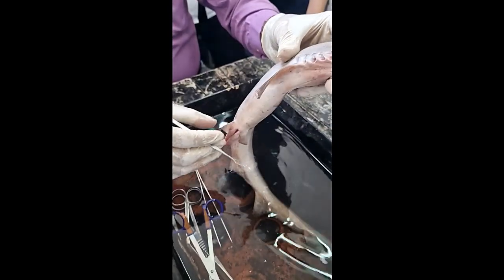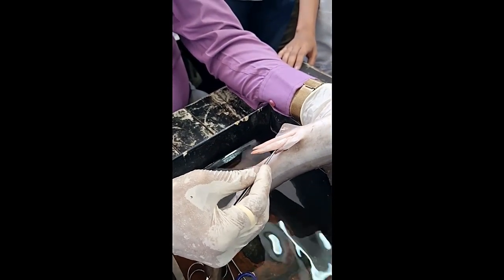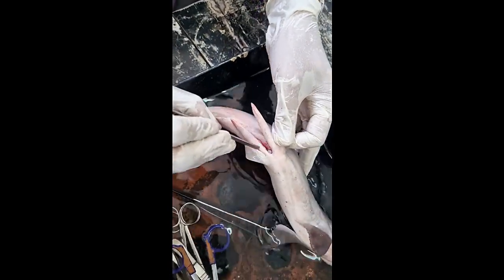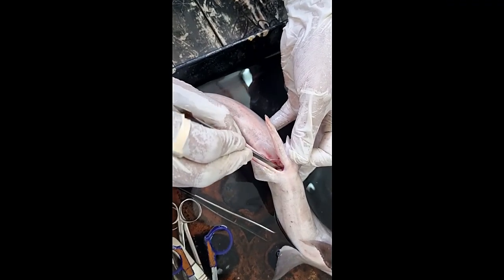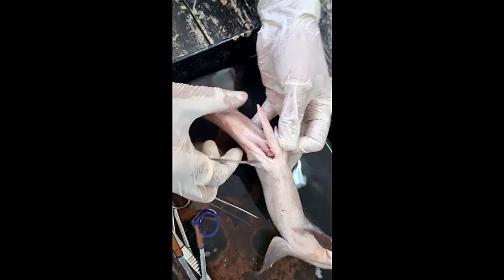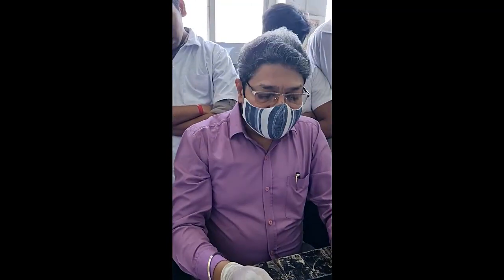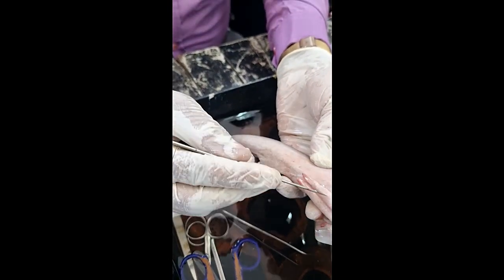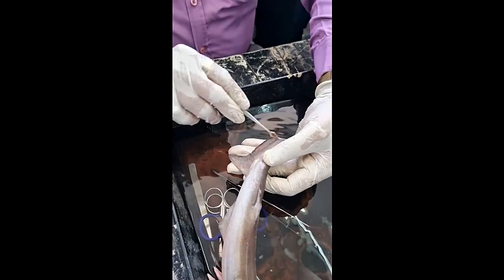Pectoral fin, pelvic fin. If it is male, the pelvic fin will also have two extensions called claspers. And this is the cloaca — this part is called the cloaca. This is a common opening for the urinogenital system and digestive system. This ventral fin is also known as the anal fin because it is close to the anus. This is the caudal fin, which is also known as the tail fin.